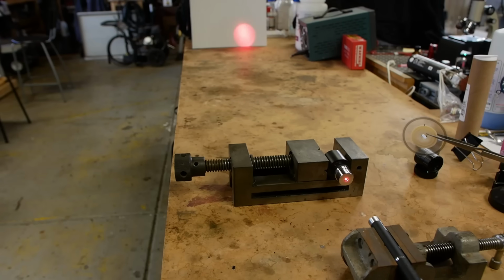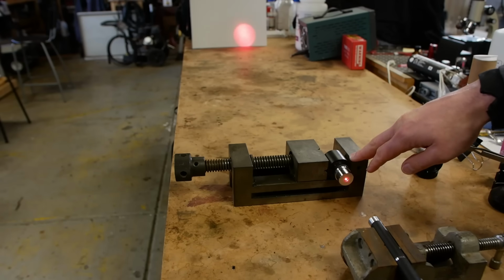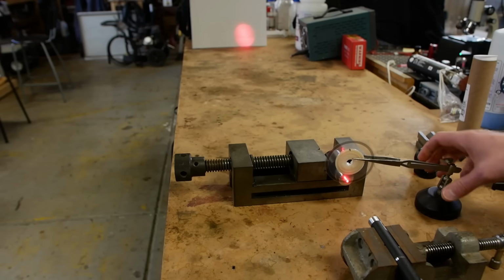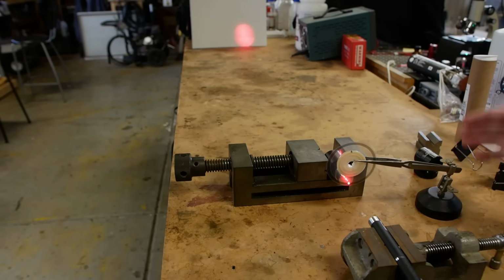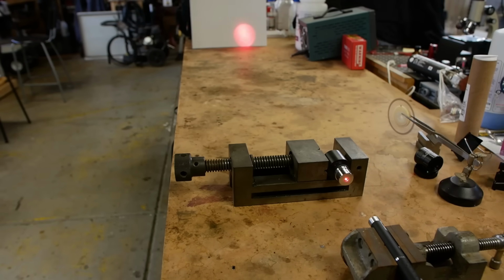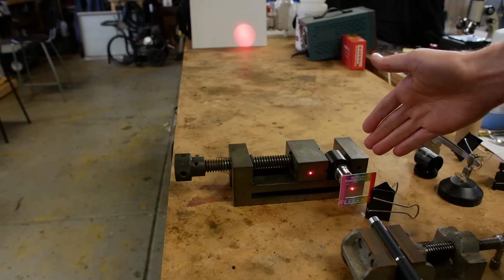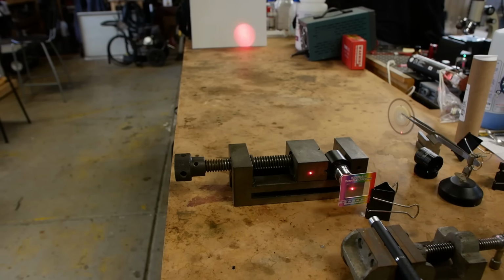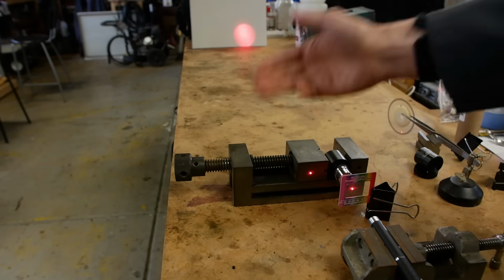We can actually see this work with real optics too. So I have a 2x microscope objective here, the laser pointer, and a screen down there. And if we put a fairly low density diffraction grating in here, it resolves the lines because the pitch of this is coarse enough that this optical system can resolve it. No problem. It's pretty obvious what's going on there. Now, if we go to a high density optical grating that this system has no chance of imaging, because we can see the diffracted beam is missing the optic entirely, we can go down there and magnify the image as much as we want and we'll never see any lines per millimeter because, again, the information is just missing.